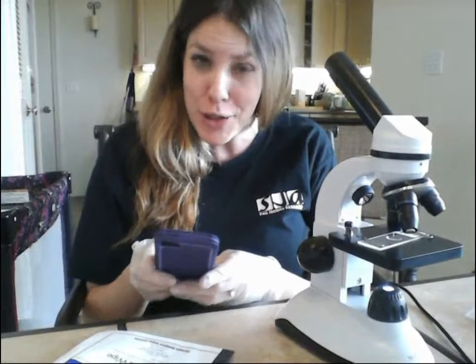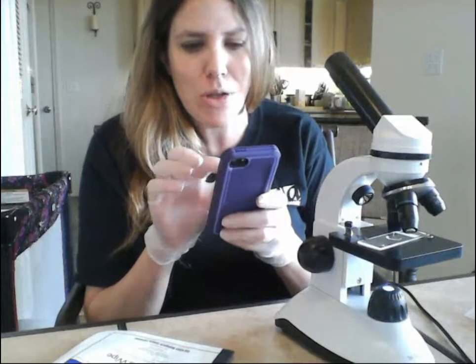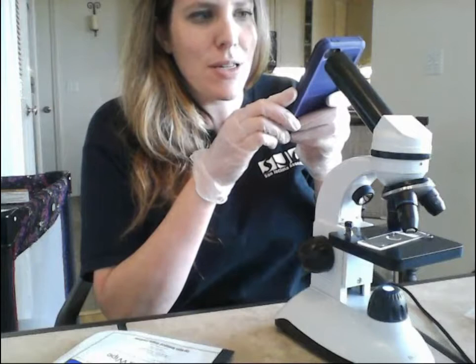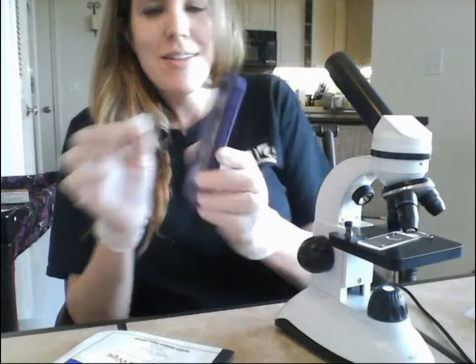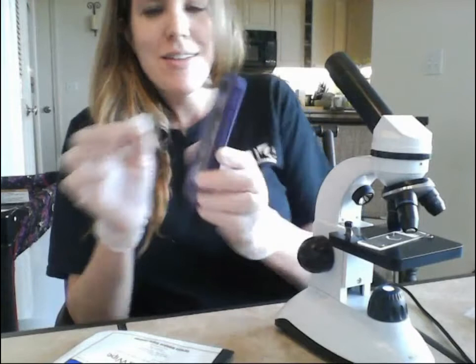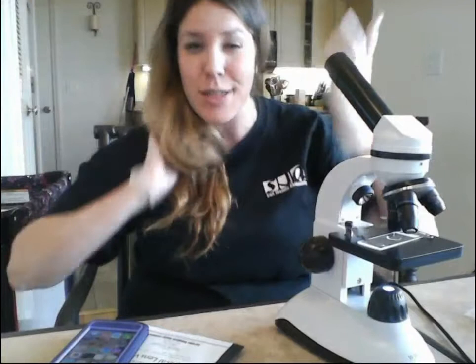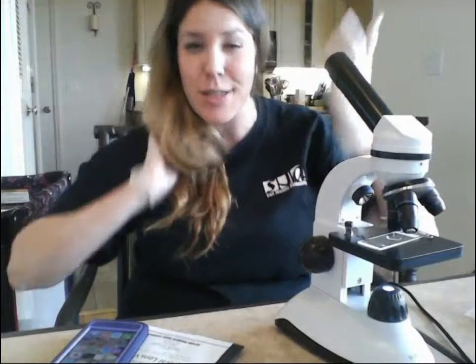At this stage your handout will ask you to take a picture of your specimen. If you have a cell phone — which I know 90% of you do — just play with it and try to get the camera right over the ocular. You'll have to play with this for a while until you get what you want. Save it as a JPEG and paste it into the picture box in the handout — I'll make a little tutorial showing you how to do that.